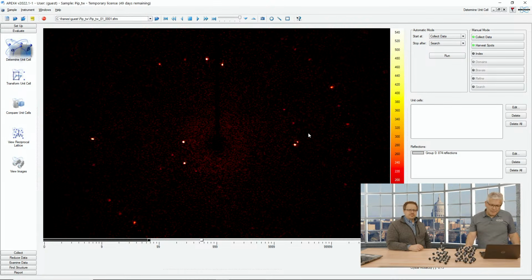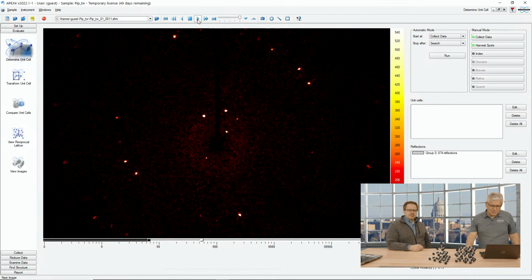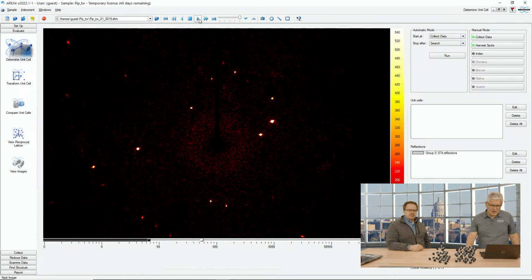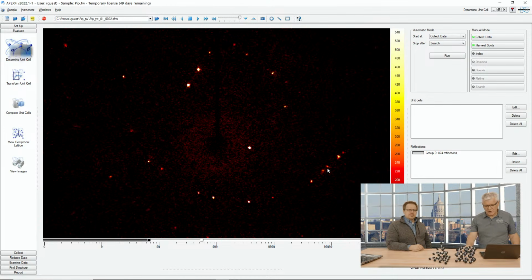And so at first glance, when you look at this, you might not even see that it's twinned, but then you get a little indication right on the first diffraction frame. There is one where you have very close distance. That would allude to a large unit cell. In other images, we see pairs of reflections. There again are these pairs of reflections. We see an overall structure, but then here they get very close. And here's a good motif, where you have these holes. These things typically are the first indication that something is not quite right.